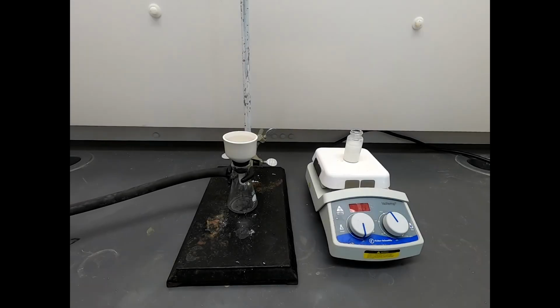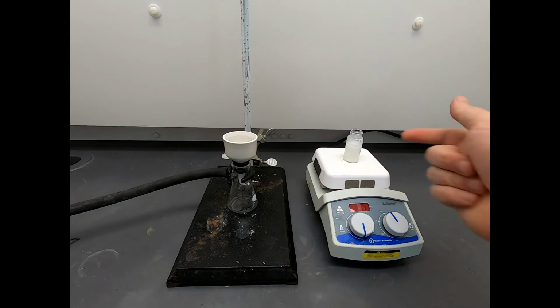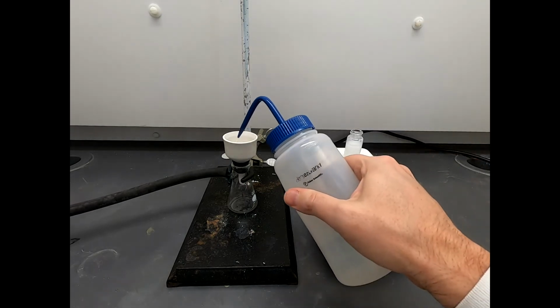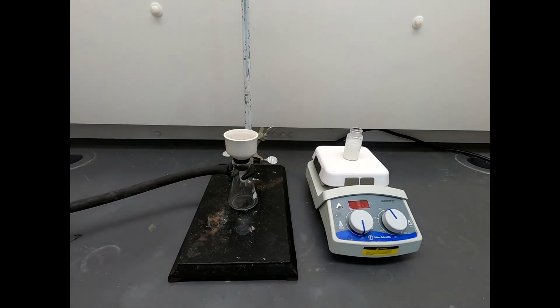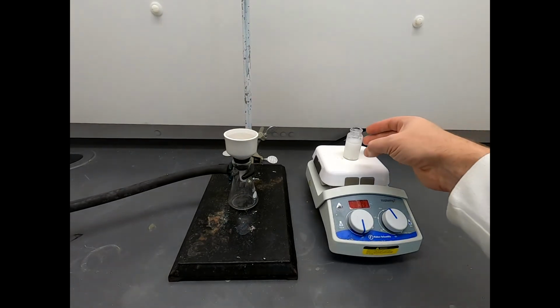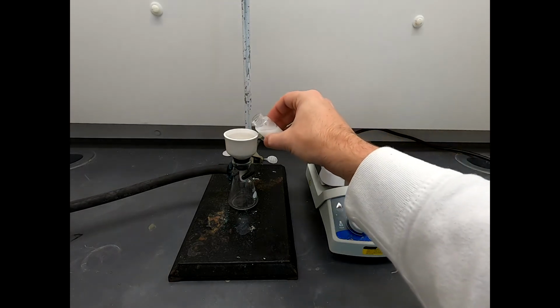Okay, we are ready just to do a filtration. There's nothing fancy about this. We have a Buchner funnel, we have a sidearm flask, and we're attached to the vacuum line. This solution is essentially water, so I'm going to seat our filter paper with water. Looks good. I'm going to peek inside the funnel and make sure all the holes are covered up. Yes, they are. Looks fantastic. And now we're going to take this and just dump it in.